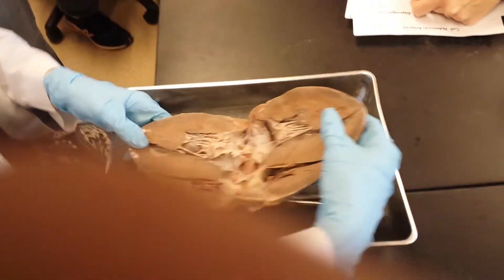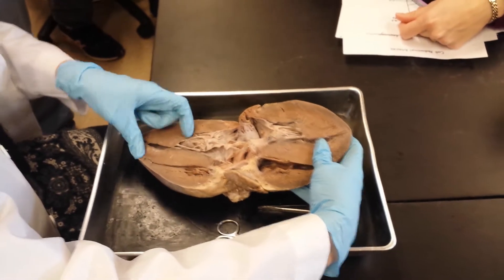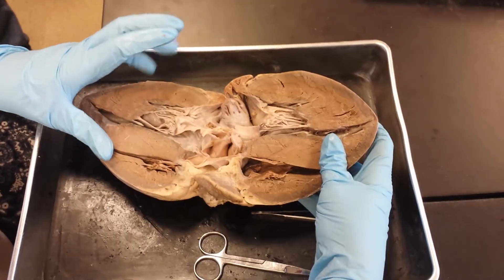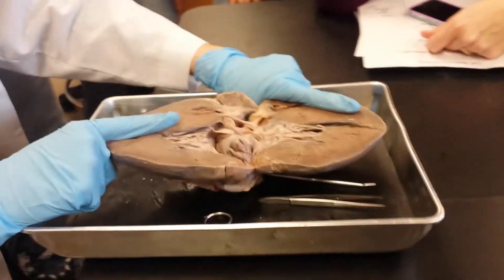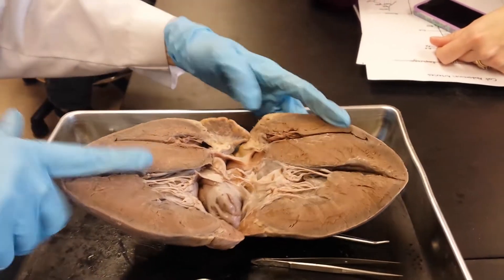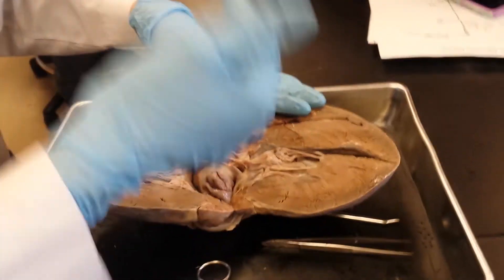Remember, some hearts might be oriented differently. I don't do that to trick you — sometimes a valve or vessel might look better from a different angle. The line that separates them is the interventricular septum. Septum means wall, and it's between the two ventricles. This is the wall that separates the right from the left. We've got to say 'interventricular' — just remember, inter means between, ventricular means ventricles.